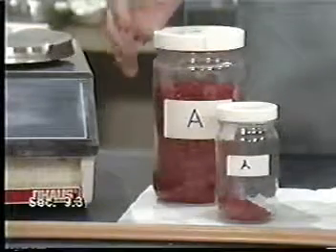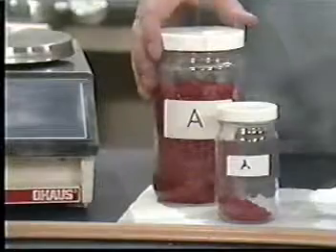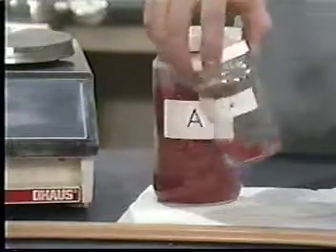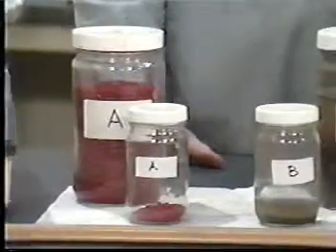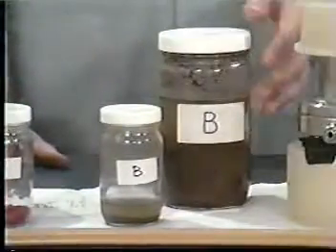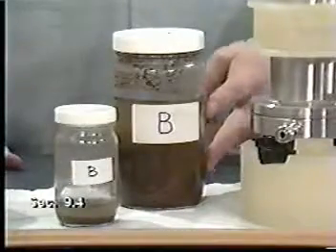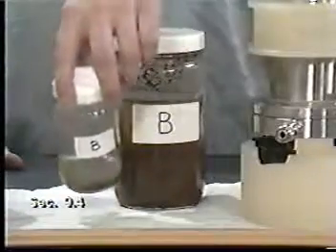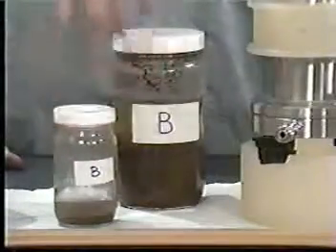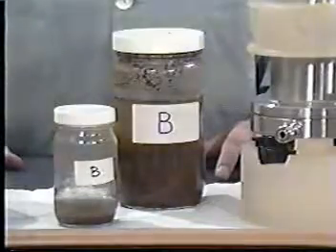If the waste is 100% solid, like our waste A, weigh a representative subsample up to 25 grams and record the exact amount. Many wastes, such as B here, have both liquid and solid phases in significant proportions. When the solids represent more than 5% of the wastes, use no more sample than is necessary to produce 25 grams of solid for the extraction.